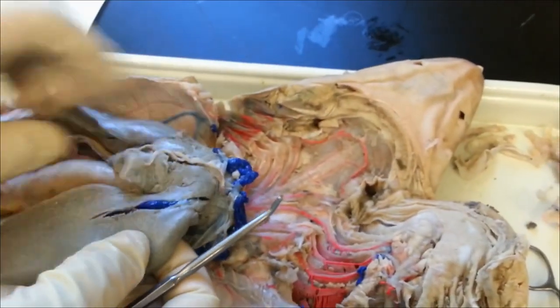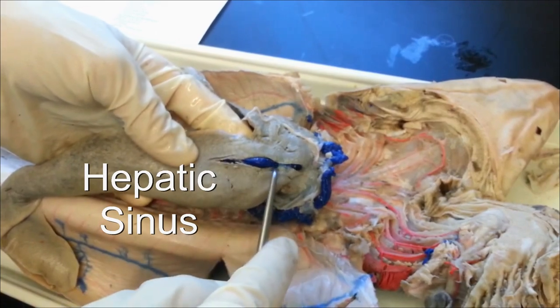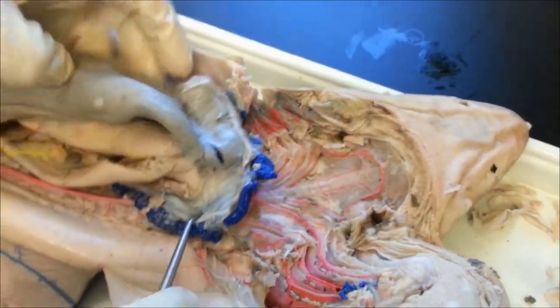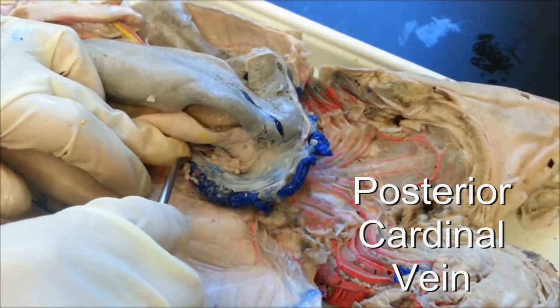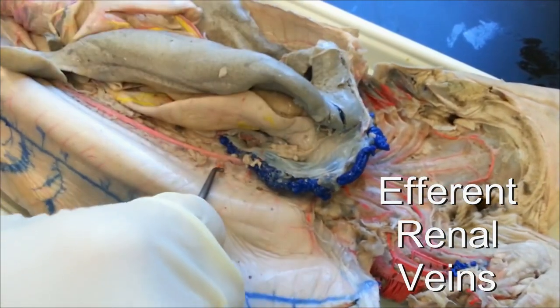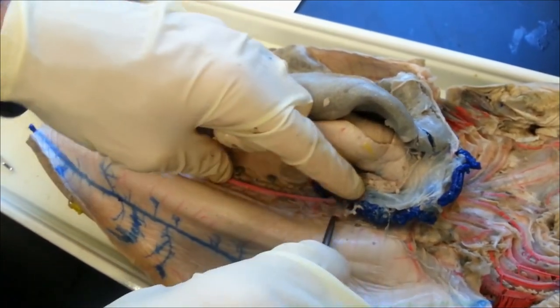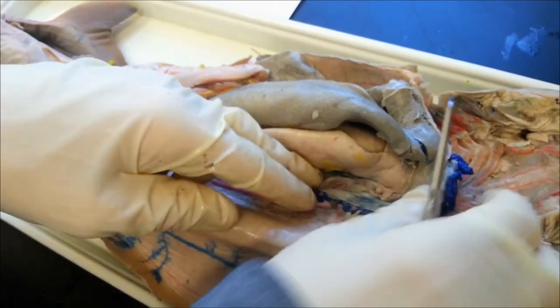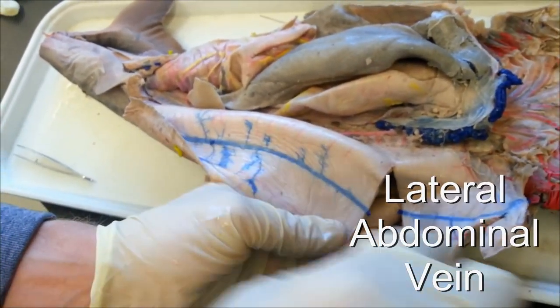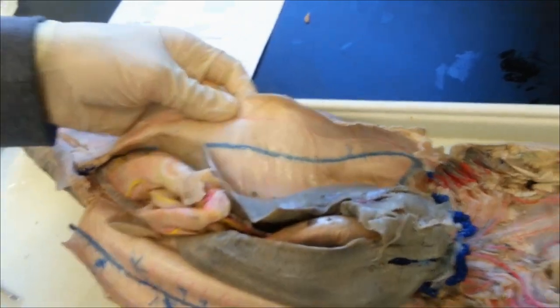Then we have the systemic veins — these are all the veins right before going up into the heart. You have the one in the liver, which is the hepatic sinus, and then you have the common cardinal vein, which is where it all comes together. Going off the side of that is the posterior cardinal vein, and coming from the kidneys into that would be the efferent renal veins. The kidneys go all the way along the dorsal surface and drain into the posterior cardinal vein. The most obvious one running right down the side is the lateral abdominal vein. That's all of the veins and arteries that you need to know.